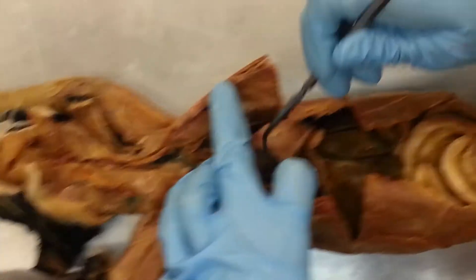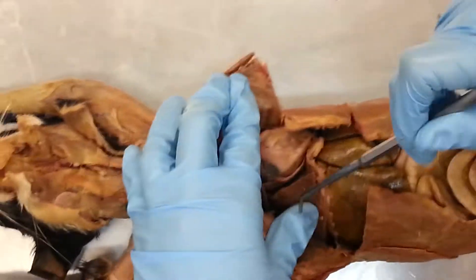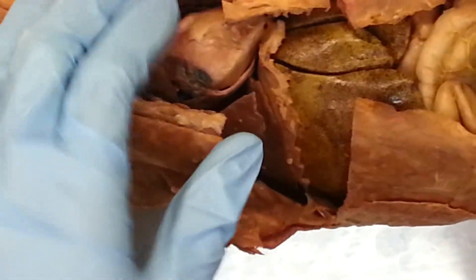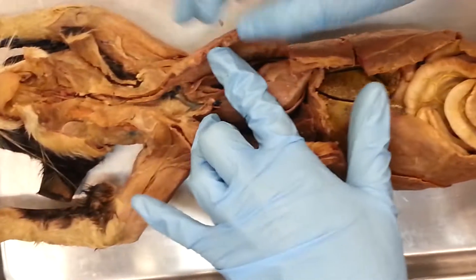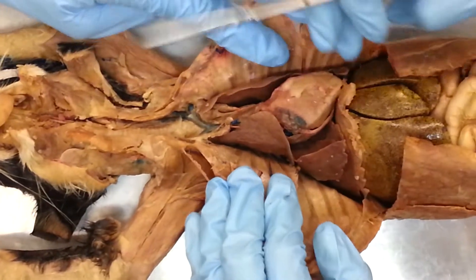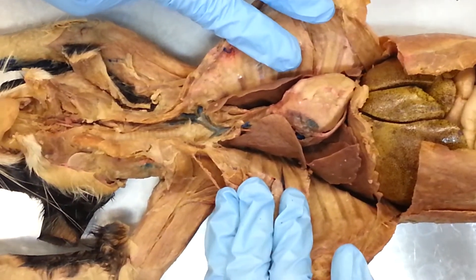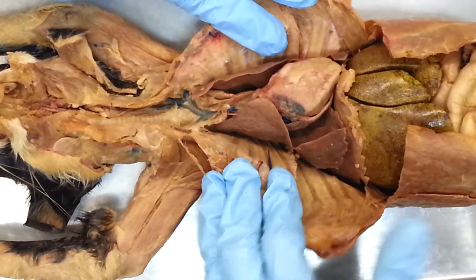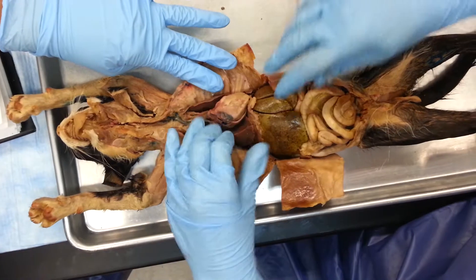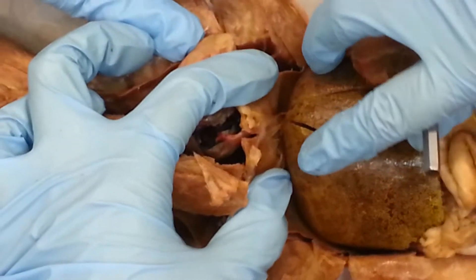This is the pericardial cavity where the heart is. This is the diaphragm right here. The mediastinum is right here, including the heart. The peritoneal cavity is down here where the intestines are. The falciform ligament is this ligament right here that connects the liver to the diaphragm.